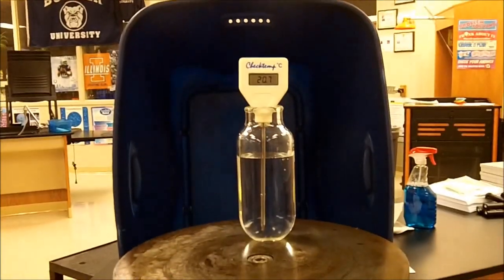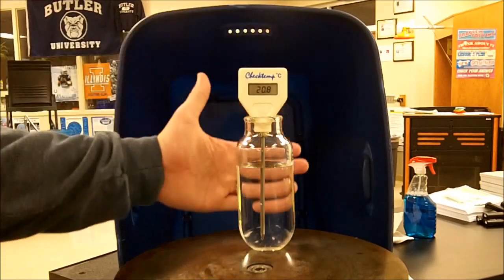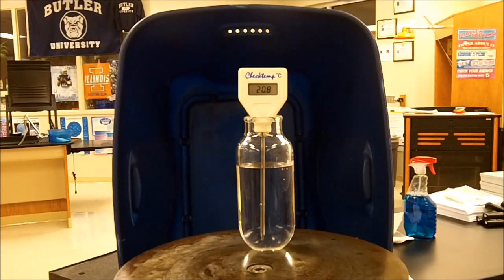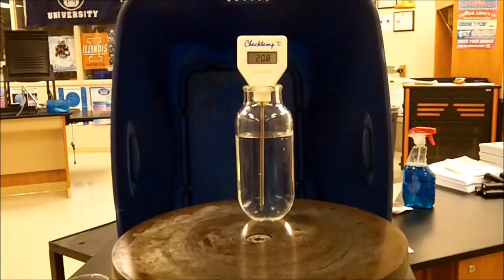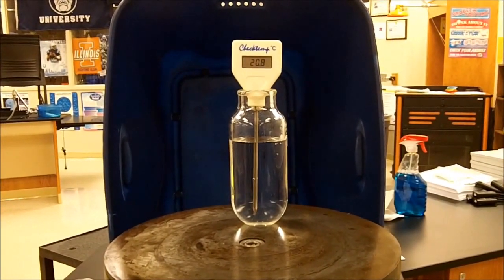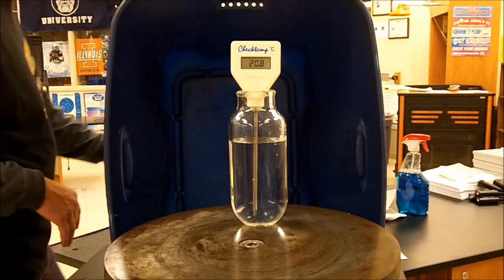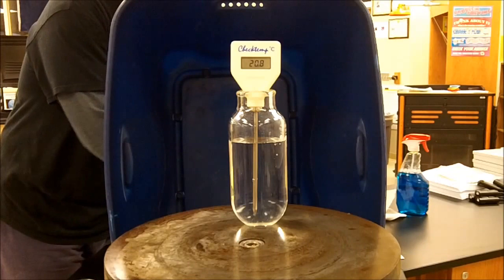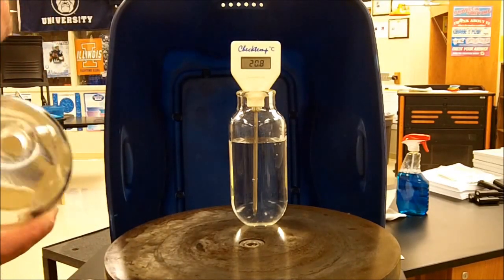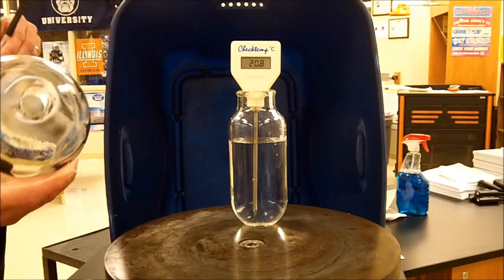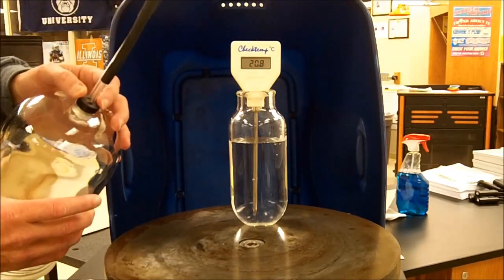So there's our thermometer and I'll go back in on that here in a second. I'm also the reason why I have this container back here just so that there's a little bit of contrast so you can see what's happening. So let me zoom out as far as I can and reposition this. And I think I'm good here. So let me go ahead and put some petroleum jelly on the bottom of the bell jar. Also what I have on top of the bell jar is there's an opening here and that allows for atmospheric pressure to reenter once we're finished with this experiment. And you'll see something pretty cool there.